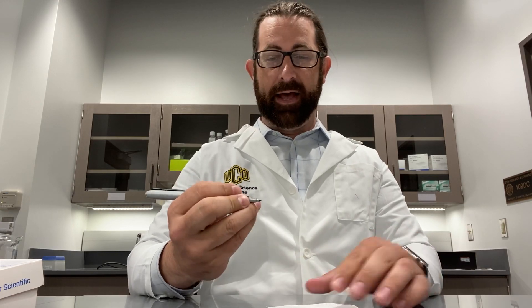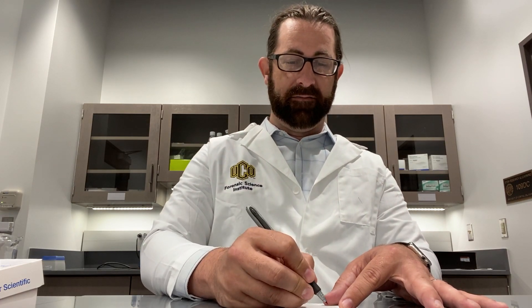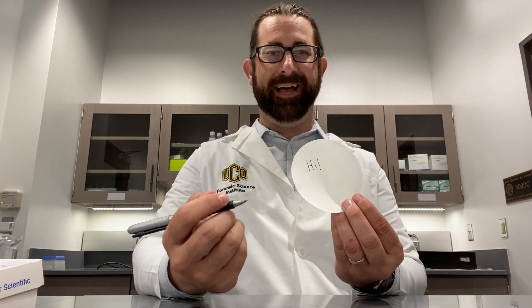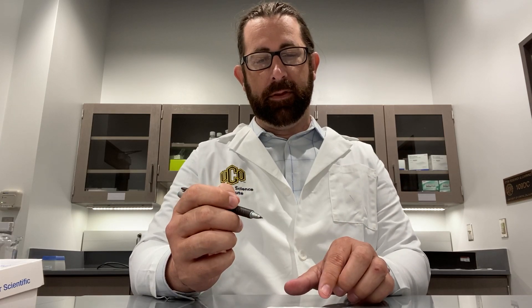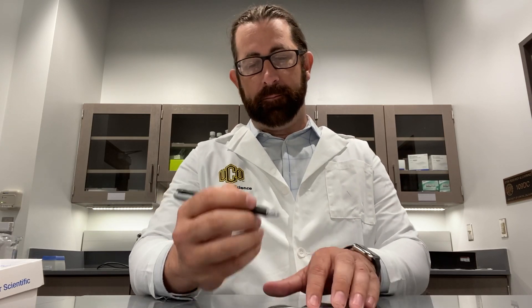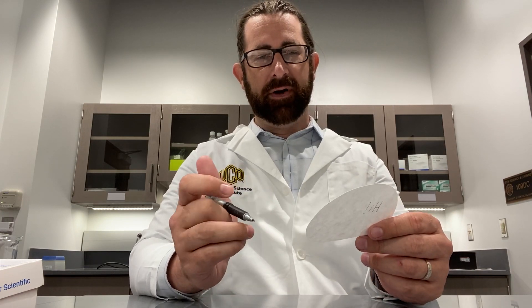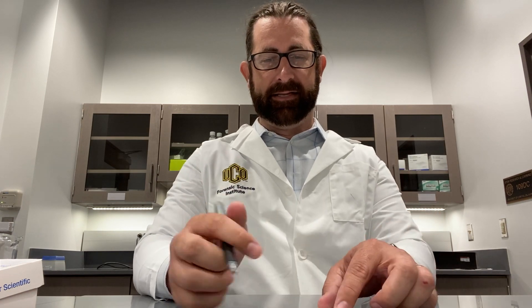So here we have our filter paper. I'm going to randomly select a pen — and I'm looking at it, so it's not super random. And I'm going to write myself a ransom note. It's going to be the very offensive message of 'Hi.' So we have this ink that's now there on the filter paper, and we want to be able to analyze this.